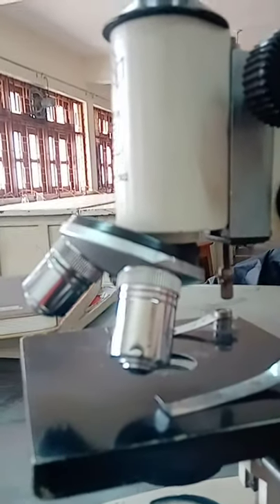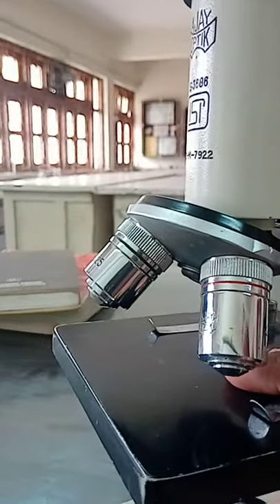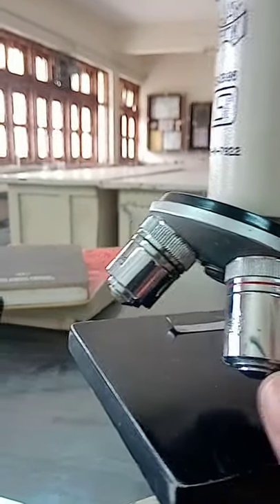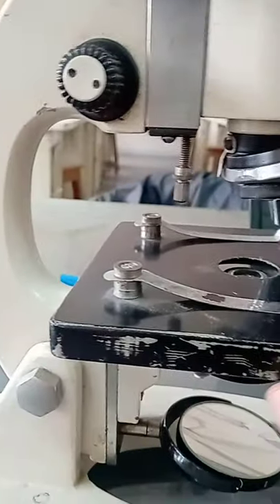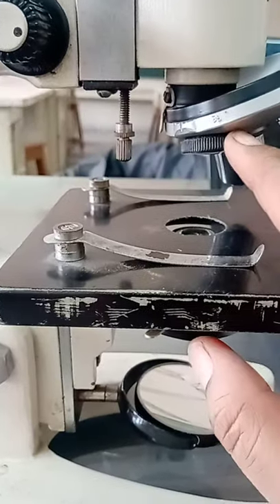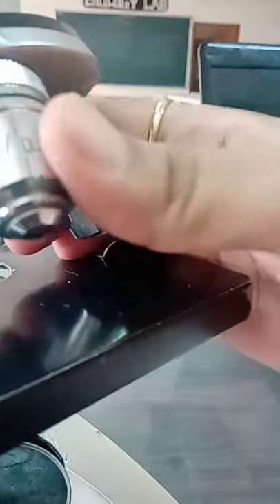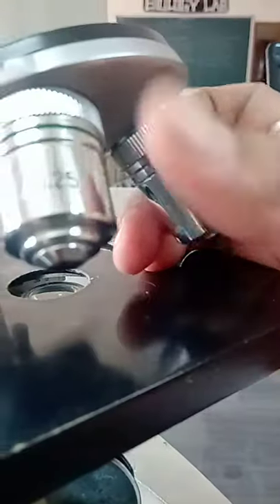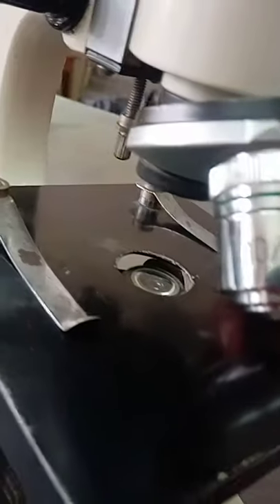On the revolving nose piece, there are generally two objective lenses. A third can be fixed of higher magnification depending upon the need. Right now, we have two objective lenses on this revolving nose piece: one is of 10x magnification and the other one is of 45x magnification.